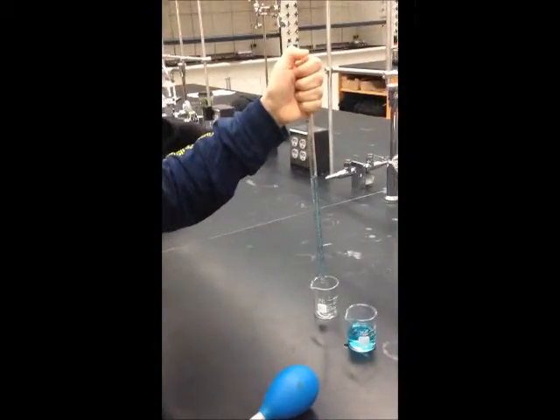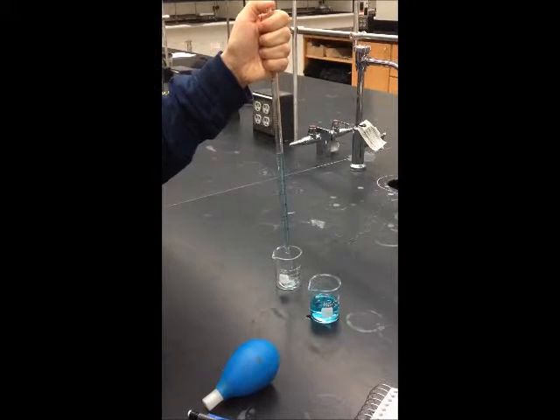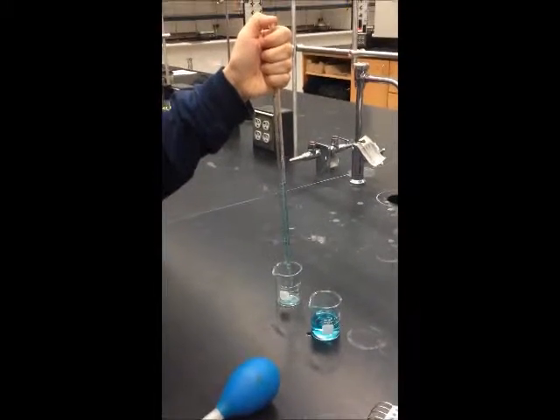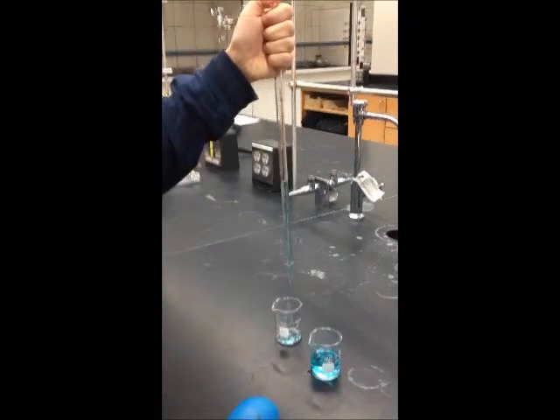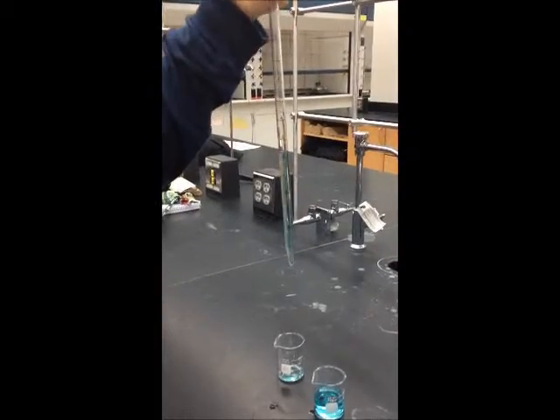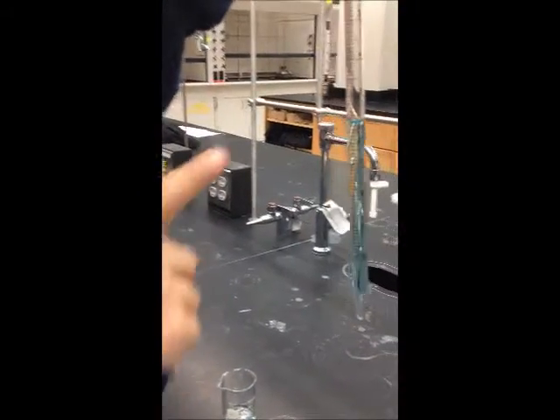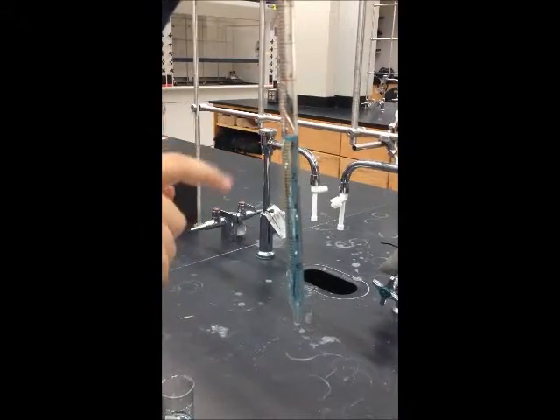To find the volume by difference, you must take another volume of the solution. Release some of the solution into another beaker by removing your thumb from the top of the pipette until you have your desired new volume. Once again, raise the pipette to eye level and read from the bottom of the meniscus. The new volume of the solution is 5.7 milliliters. Once you record the volume, you can release the remaining solution into a beaker.